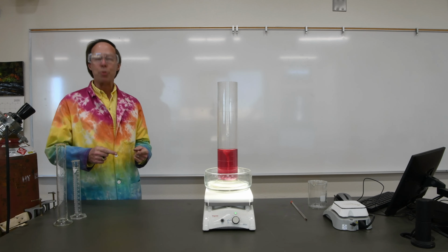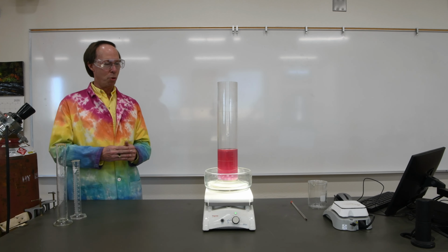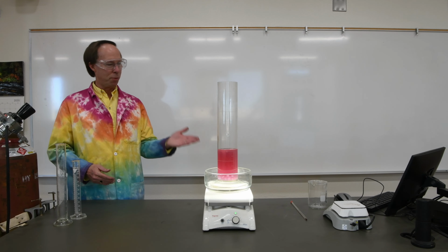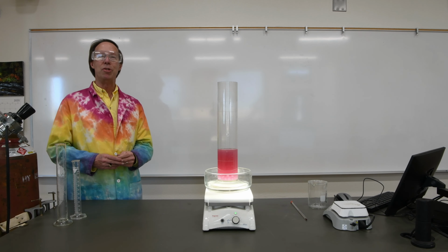It changed while it was participating in the reaction. Now it's gone back to its original form. We could use it again. If I added more fuel, more oxygen, that reaction would take off again just as it did the first time.